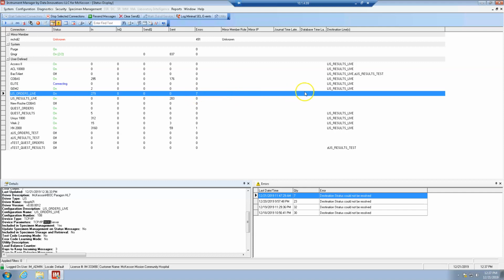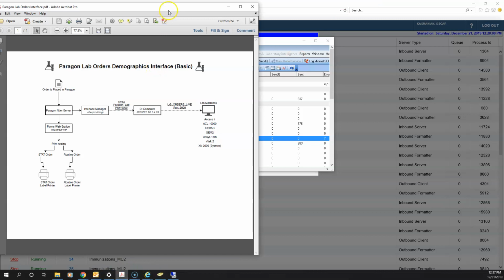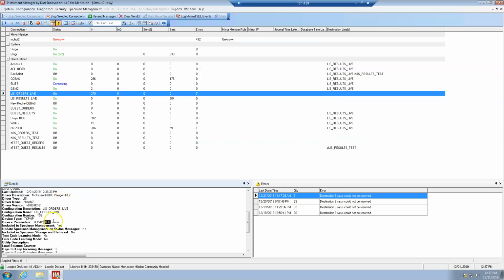Okay, so what happens, and I'll open up the diagram again. So we're basically at this step here. We went through the interface manager. We've checked these interfaces in N-tier, in Paragon, and we see that everything's okay. So we've logged into the DI, and we are checking this interface here to see if everything is okay. So LIS orders live, port 9000. This order is live on port 9000. Great. So there's an in.